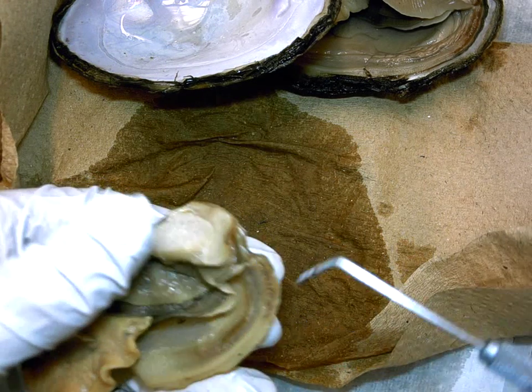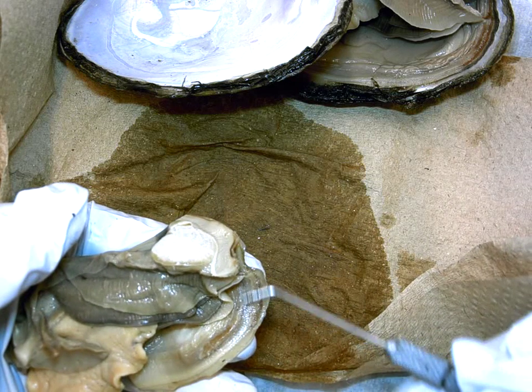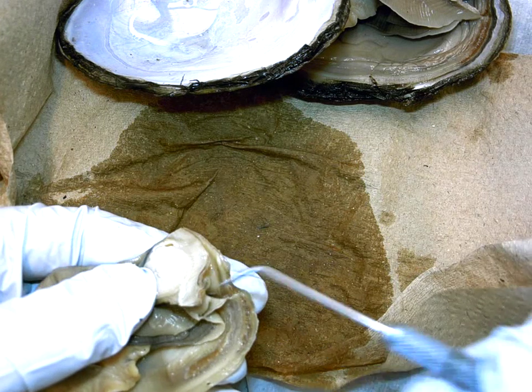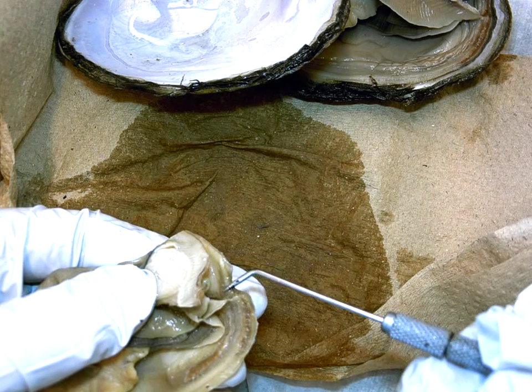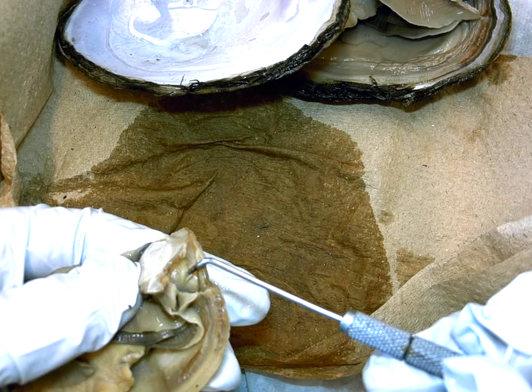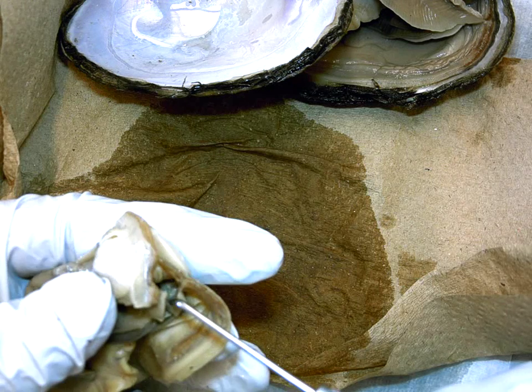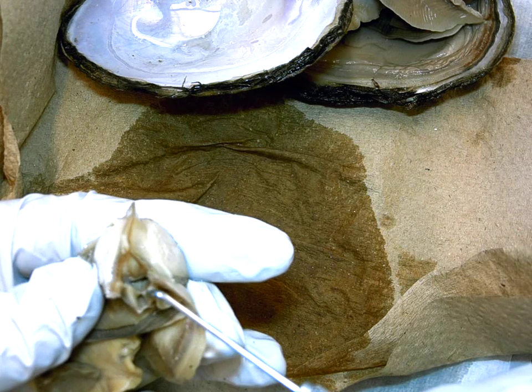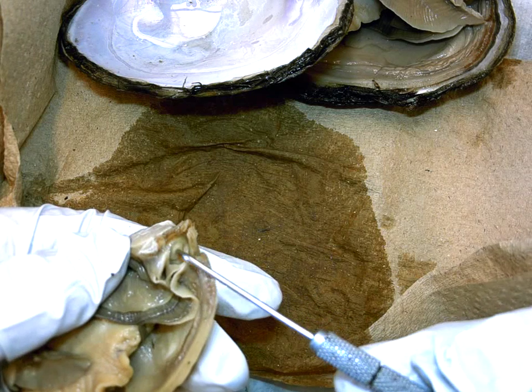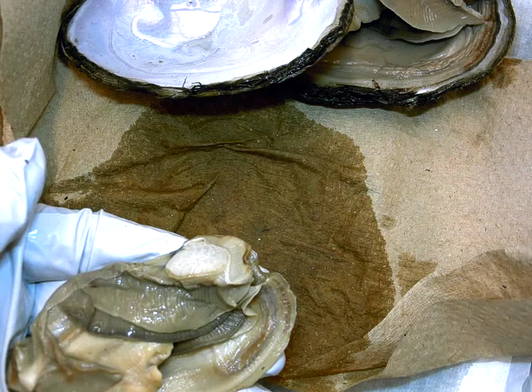Now keep in mind this is the posterior side of the animal, and here is that dark pigmented area that has a name we mentioned earlier in the lab, and here's another dark pigmented area that we mentioned earlier in the lab, and the anus is right next to it, which is right here. Think of it like a little pathway. You can see I'm opening up here, looking down into the animal. So again, your job in the lab is to figure out why this is the perfect location for the anus.